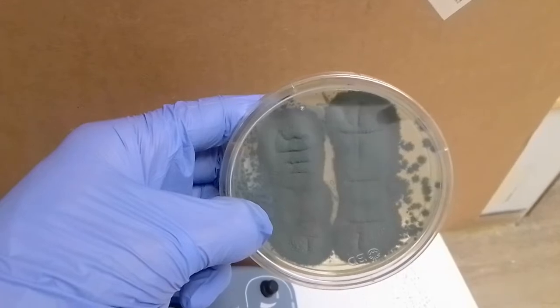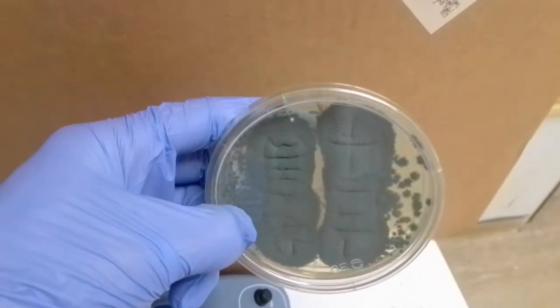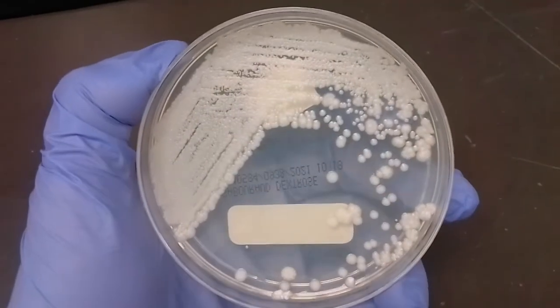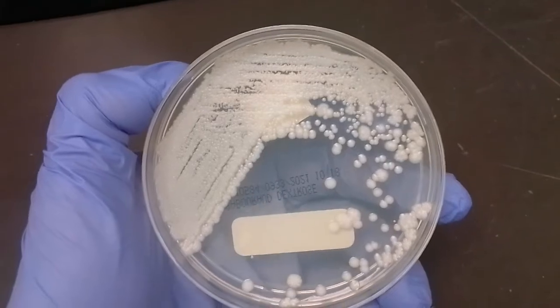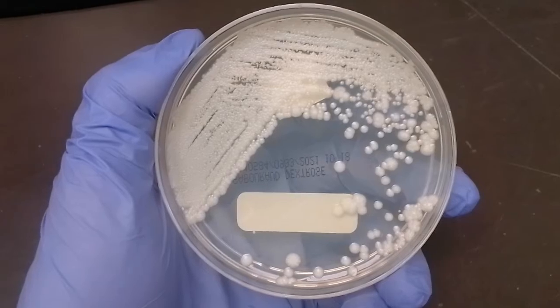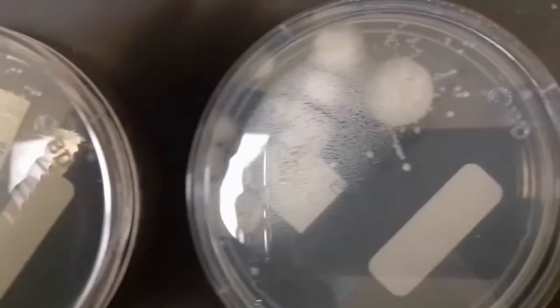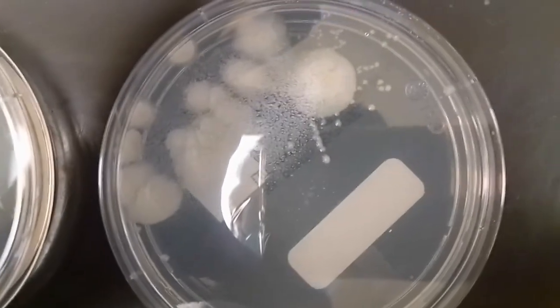Other types of specific cultures would include a fungal culture. You generally can't get molds or yeast on a regular culture properly — if it's a fast-growing mold or yeast it may show up, but that's not the proper way to do a fungal culture if you're suspecting fungal in that specimen. You'll have to do a specific fungal culture which has its own plates, its own incubation temperature of 30 degrees, and we do that for four weeks, whereas a regular bacterial culture is generally just for a few days.